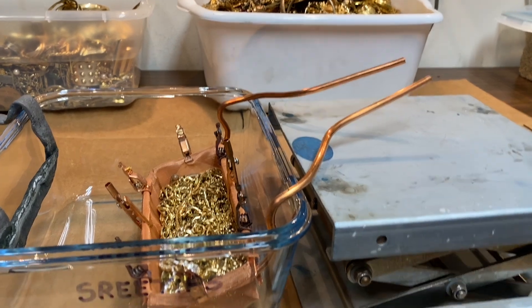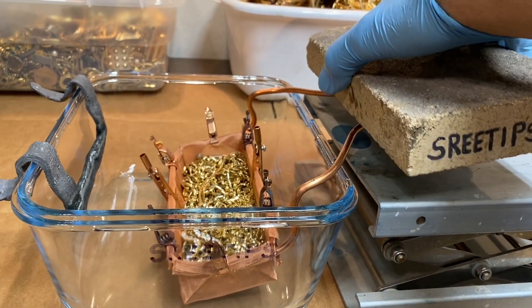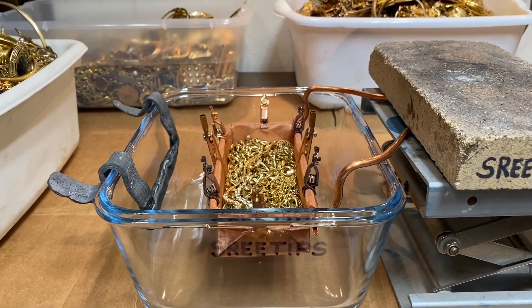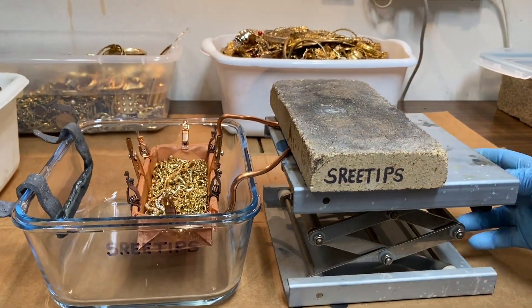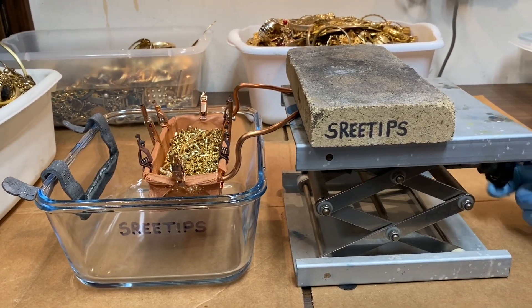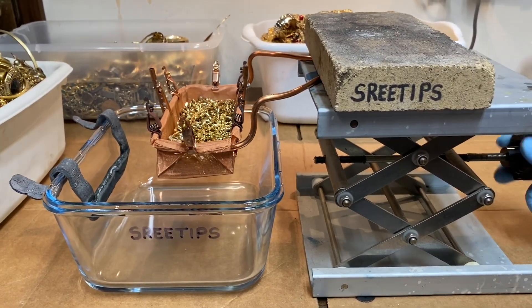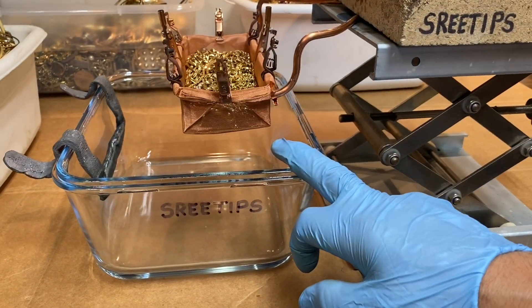I'm going to put it into the cell like this — I can kind of maneuver things around it when I get it working. We'll crank on this lab jack that I bought a hundred years ago. I've never used it for anything, well I guess I've used it for some burner things. And we'll be able to fill this up with electrolyte now.